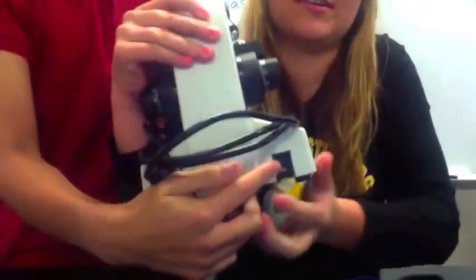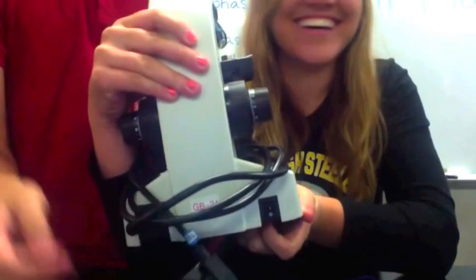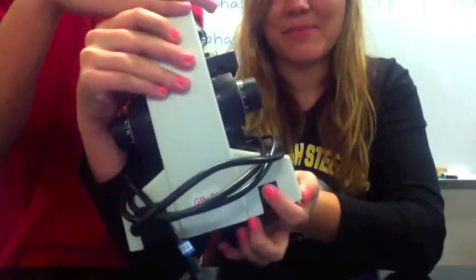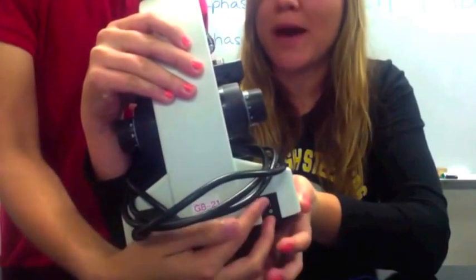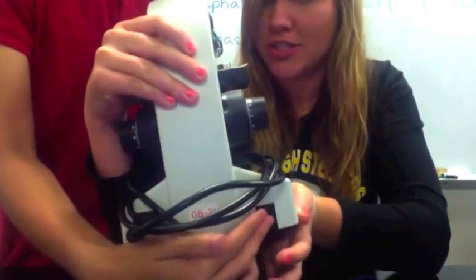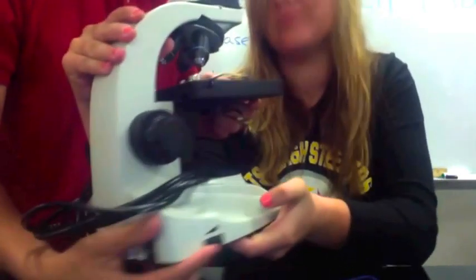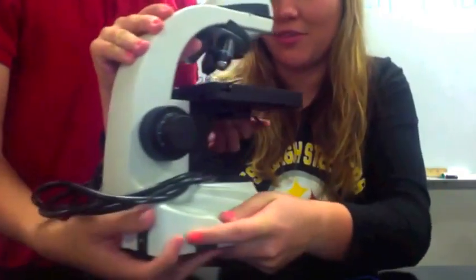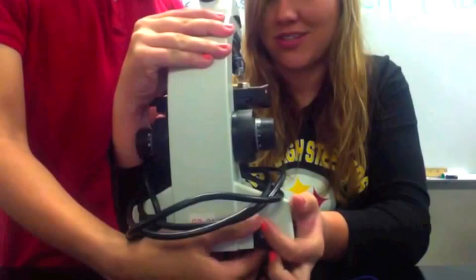This here is the power switch — not the light switch, the power switch. The light control is separate from the power switch. Light control dims or brightens the light; the power switch turns the microscope on or off. Know the difference: light control versus power switch.